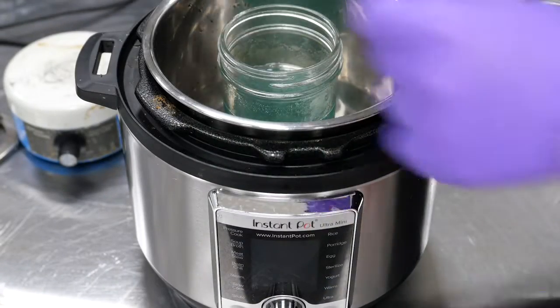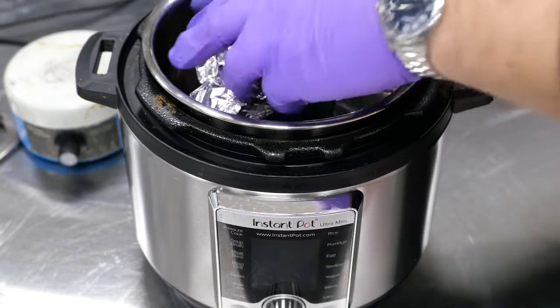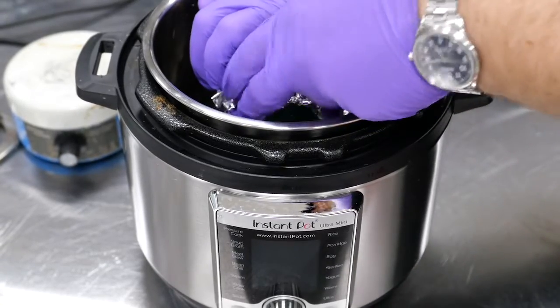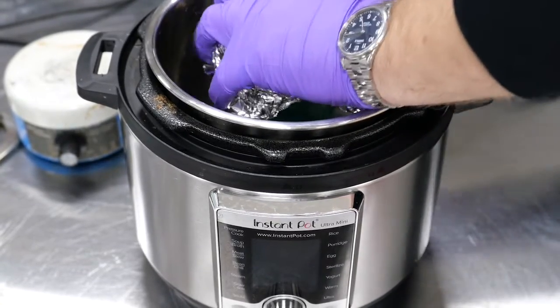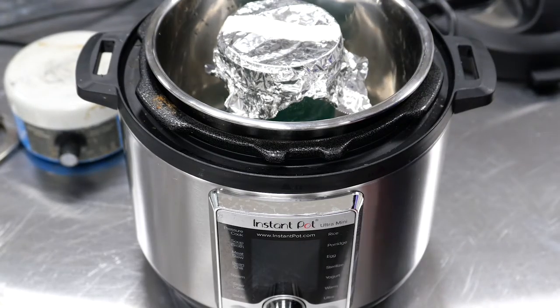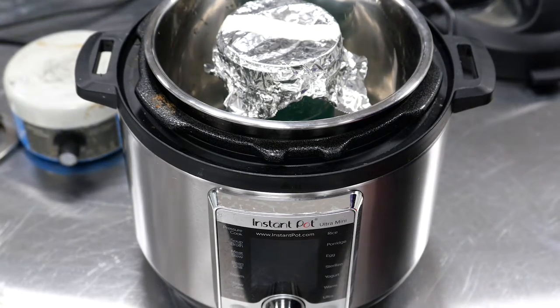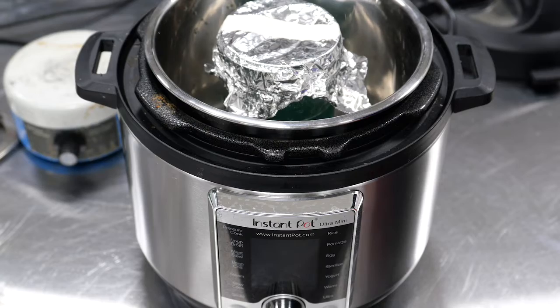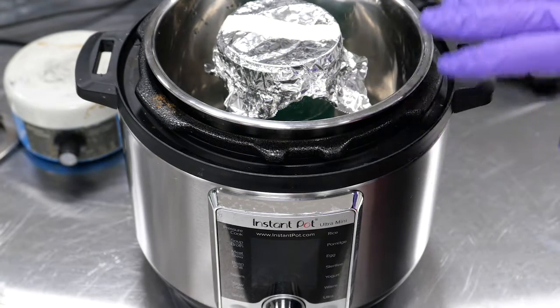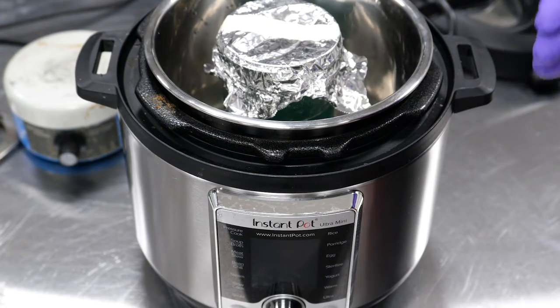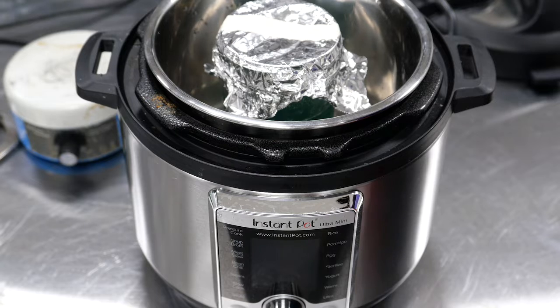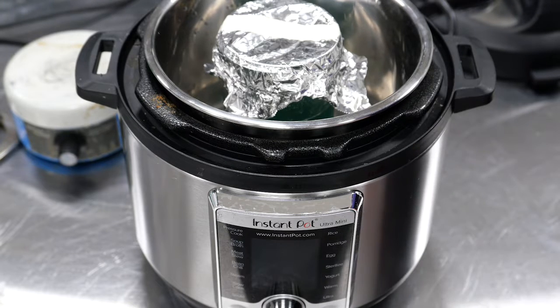So that's good and mixed up. I'm going to add some foil over the top and put it in this instant pot. With any autoclave, and really I'm going to consider an instant pot to be pretty close, it doesn't quite get to the same pressure. These usually get to about 12 or 13 PSI, where an autoclave will get to 15. But for the purpose of most of our standard brewing laboratory growth media, it's going to work okay. We're going to have a way to check and make sure that our plates are clean before we use them.